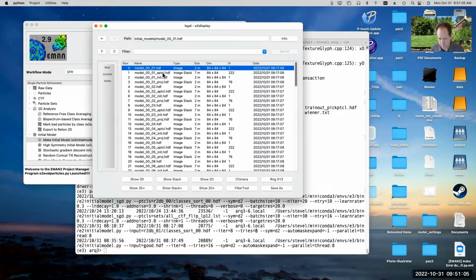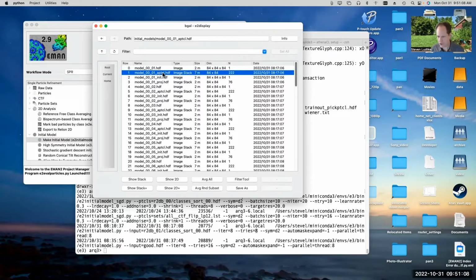Then it has this particle file, which allows you to compare the projections that it used with the class averages.